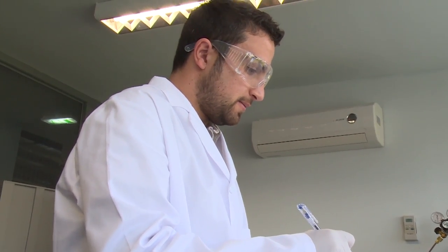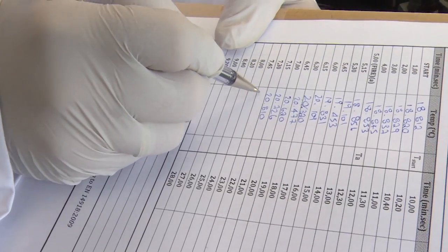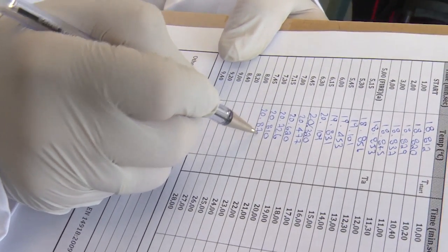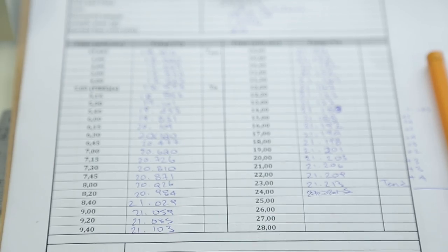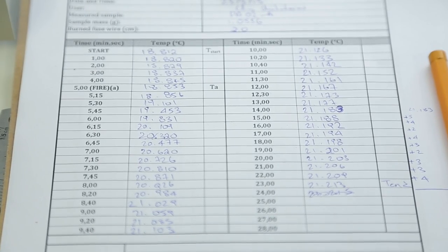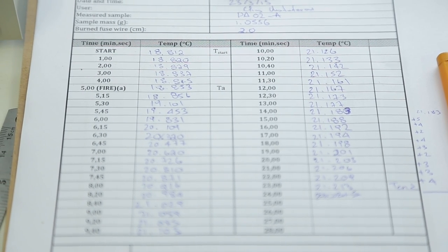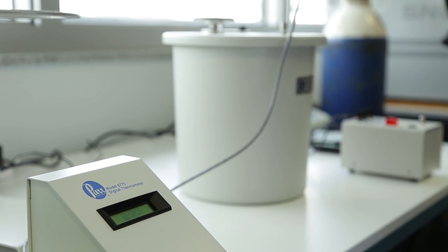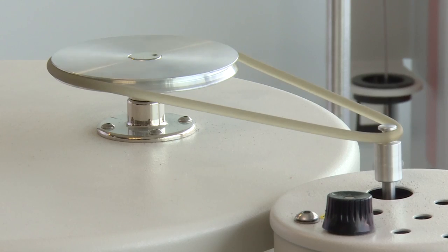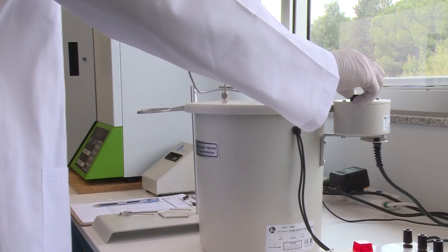60, 75, 90, and 105 seconds after firing and interpolate between these readings to identify the 60% point after the total rise has been measured. After the rapid rise period about 4 or 5 minutes after ignition, record temperatures at 1 minute intervals until the difference between successive readings has been constant for 5 minutes.